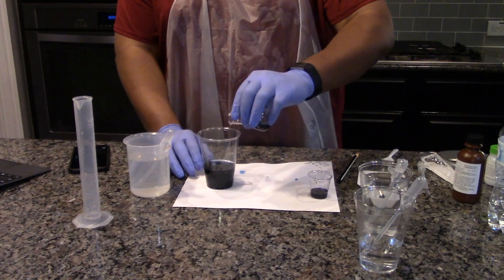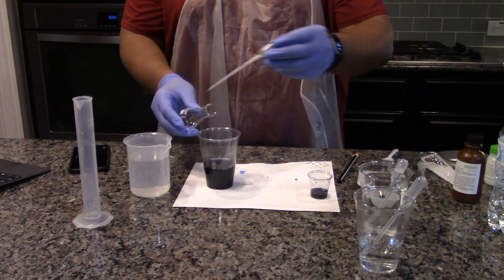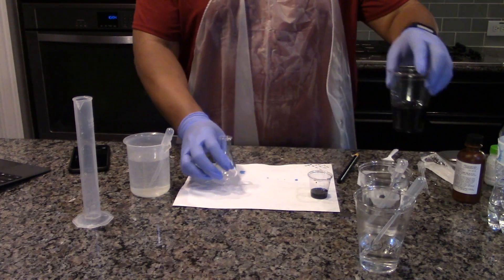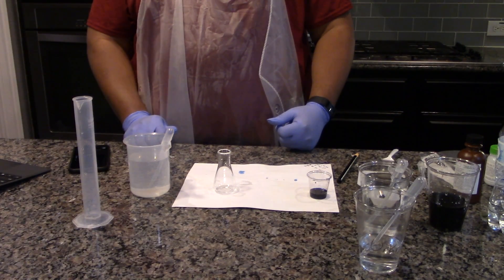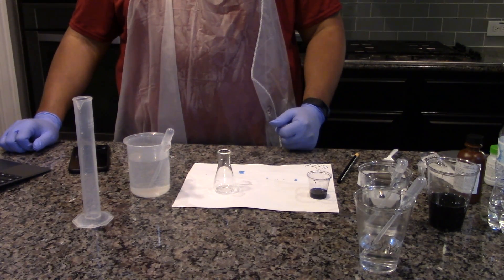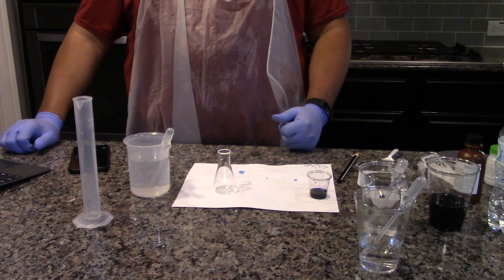Empty the flask into the 10-ounce cup for waste. Rinse the flask with pure water and empty the rinse water into the waste cup. Repeat the titration of the unknown concentration two more times. This concludes the experiment portion of the lab. Dispose of any unused chemicals down the drain with excess running water. Wash and dry all lab equipment and return it to the equipment kit.